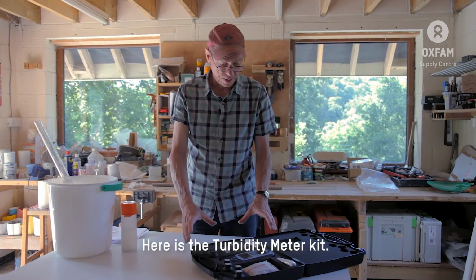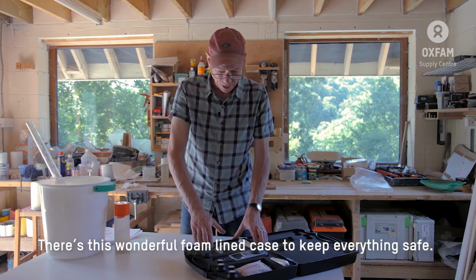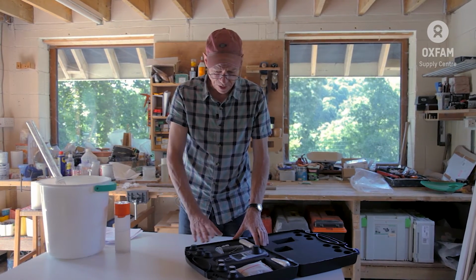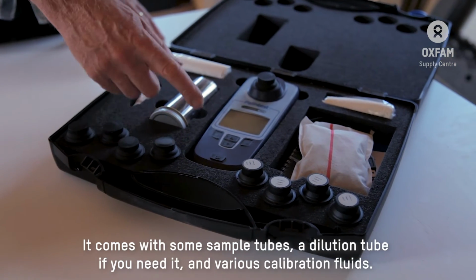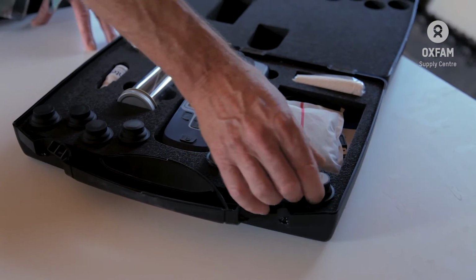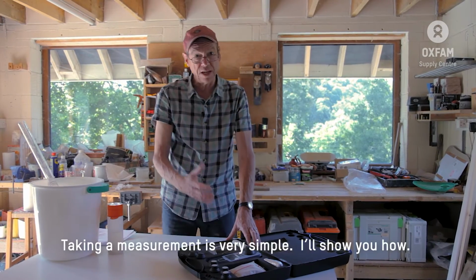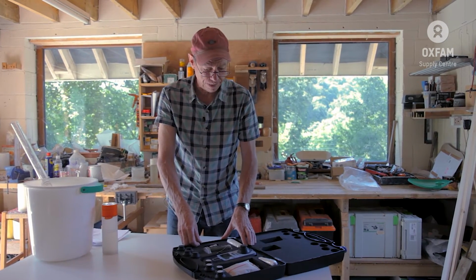So here's the turbidity meter kit. It has this wonderful foam-lined case to keep everything safe. It comes with some sample tubes, a dilution tube if you need it, and various calibration fluids here. Taking a measurement is actually very, very simple. I'll show you how to do it.